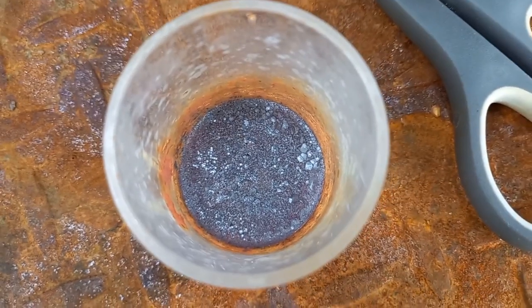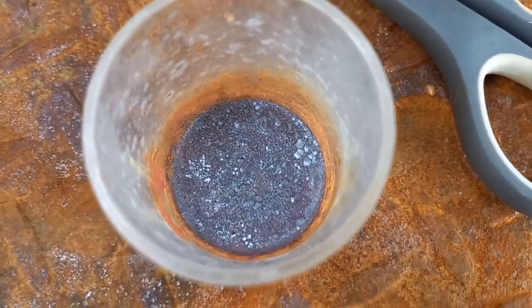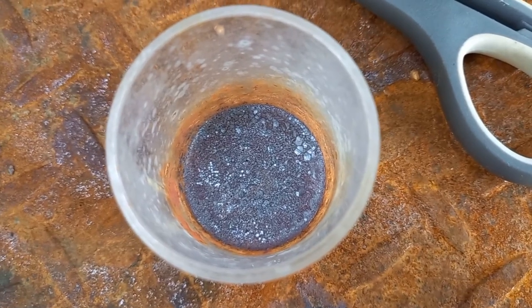Solidifying, instantly forming crystals that could in fact be bismuth.